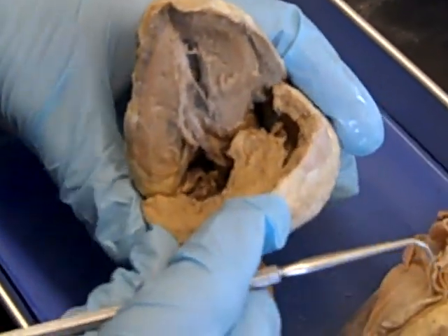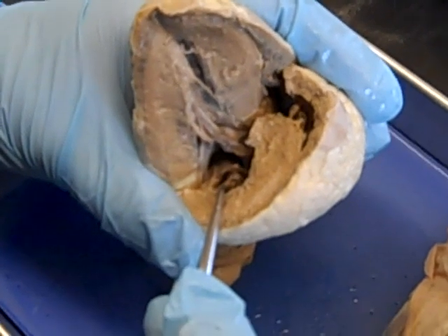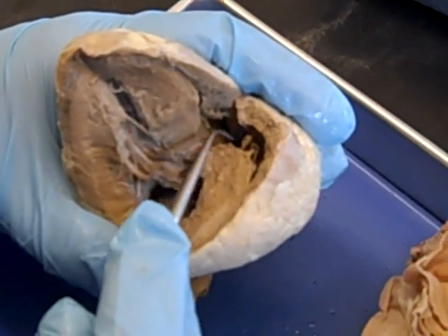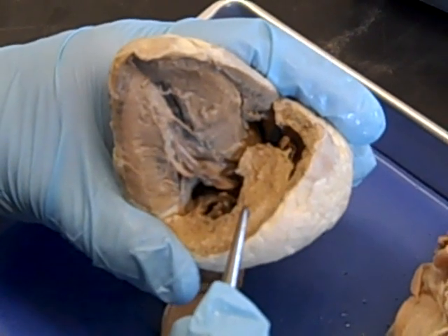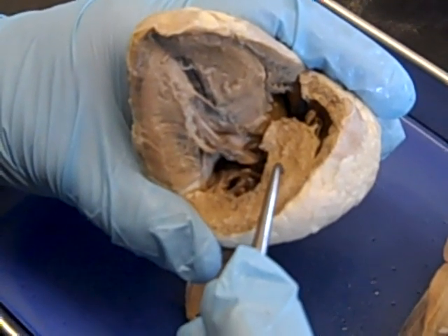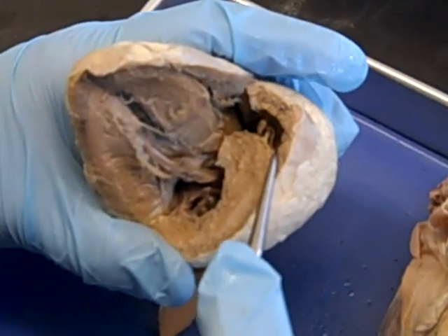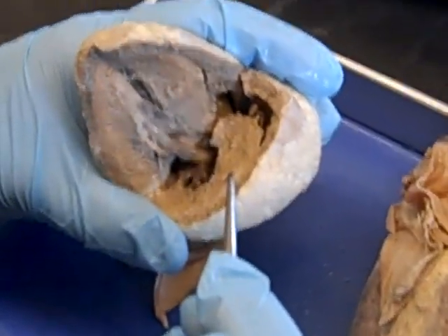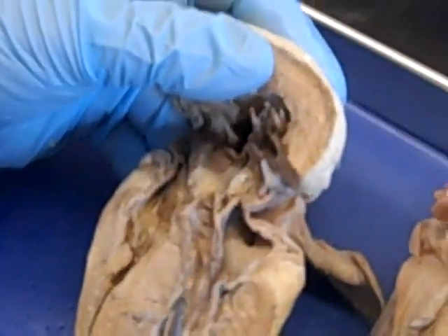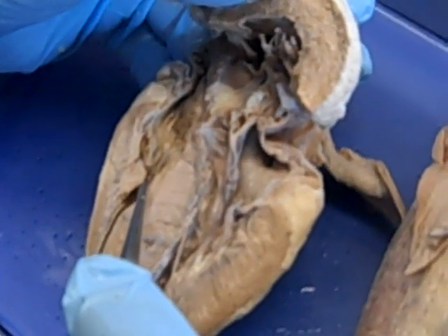This heart has been cut so that you can see the shape of the ventricular space. The left ventricle looks like a cylinder — sort of round in cross-section. The right ventricle looks like a crescent moon and wraps around the left ventricle. This happens because the walls surrounding the left ventricle are so thick and strong that the thinner right ventricular wall gets deformed and changes shape to conform to it. It can look like the left ventricle is bigger, but the left and right ventricles have the same volume — they pump the same amount of blood.